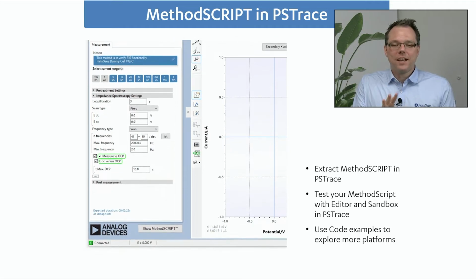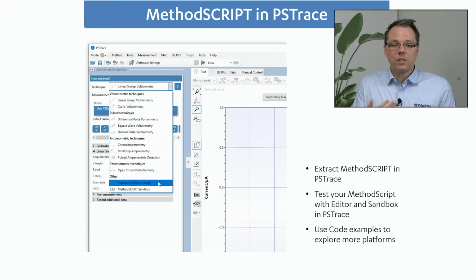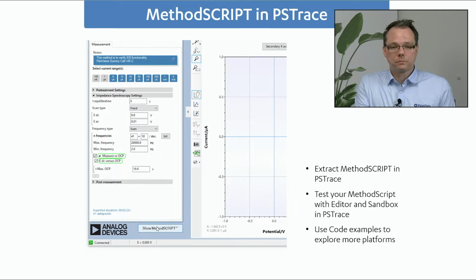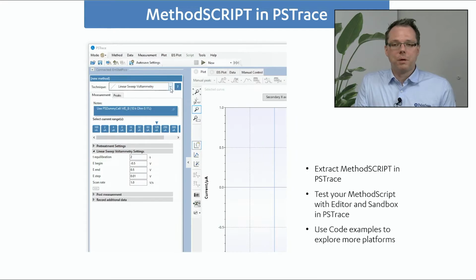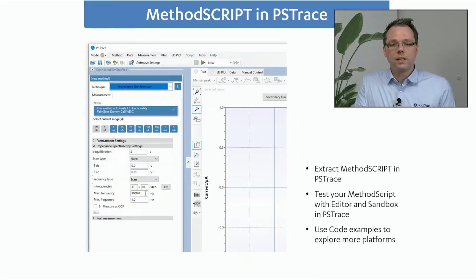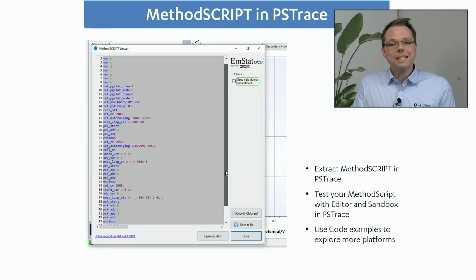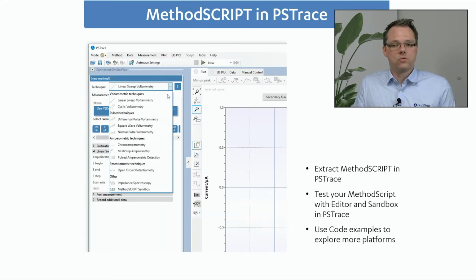In PSTrace, we have a button called Show MethodSCRIPT. And with that, you can open the MethodSCRIPT window that then shows the code that's used for performing exactly the method that is now in the method editor. Right, you can also then copy-paste that to the clipboard and add it to the code that you're writing, or you can use it with a MethodSCRIPT sandbox and editor to immediately test your newly written code in PSTrace so that you get it visualized in PSTrace.